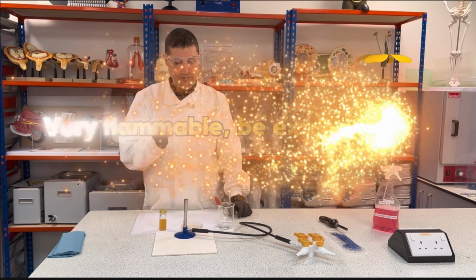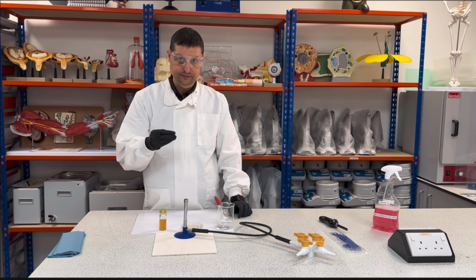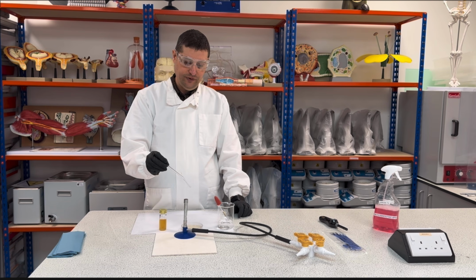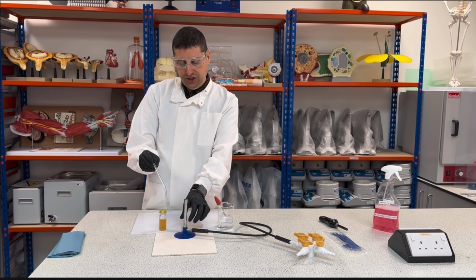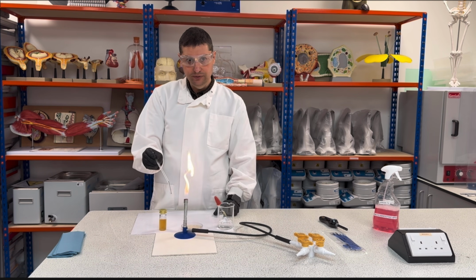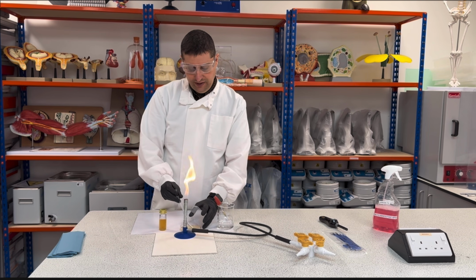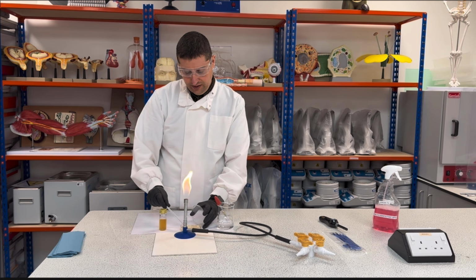Then I will take this off. Remember, this is ethanol. Ethanol is highly flammable, so you need to be very careful what you're doing. So you're gonna dry this out, okay, to remove the excess of ethanol you might have, and then you're gonna flame it to guarantee this is completely sterile. Then take from the fire, change the fire for slow and wait a little bit. Then you open and you spread your sample in the gel.